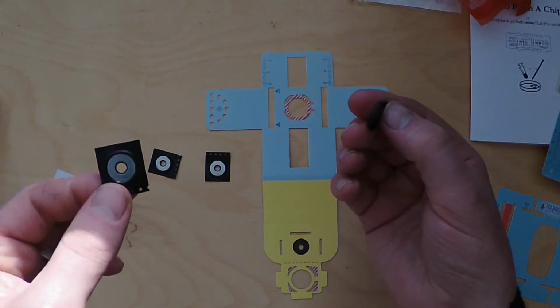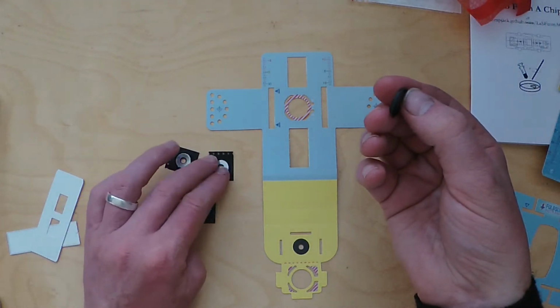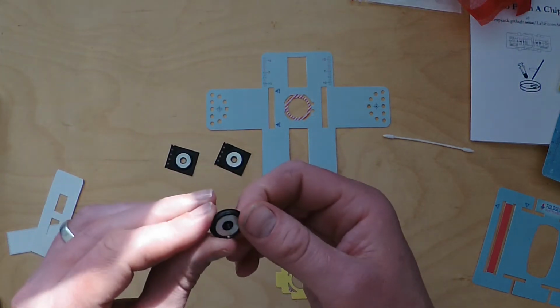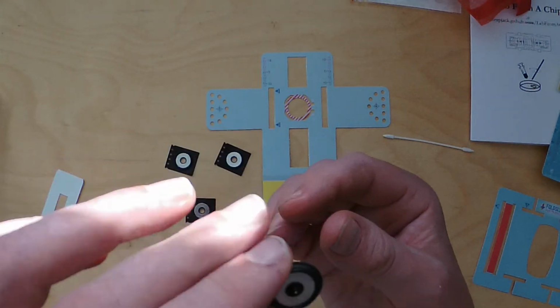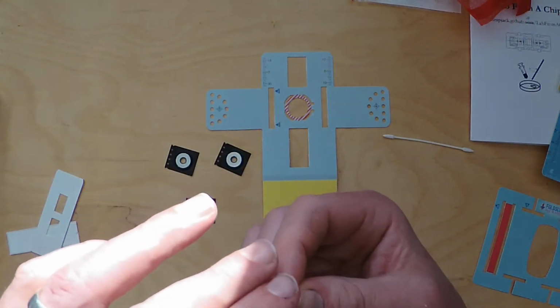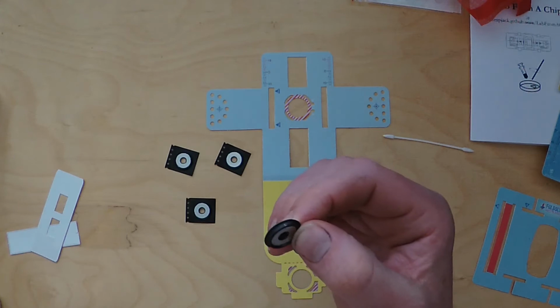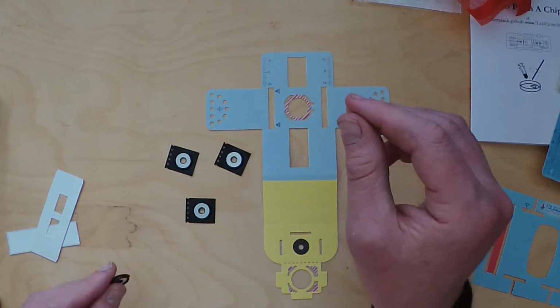and you'll see it's just the same as the other couplers, magnetic couplers. Except you'll see, the silver side, non-silver side. There's the lens just at the very point there that you can see, and that's what does all the magic. Much like the original ball lenses of the very first microscopes in the 17th, 18th century. We'll talk about that another time. Okay, so there's your components.